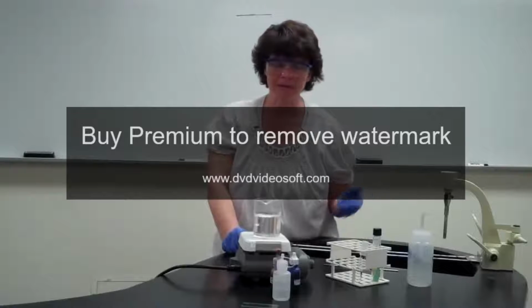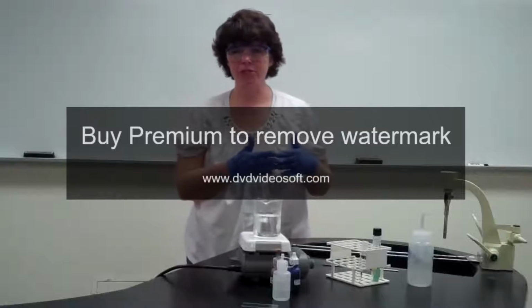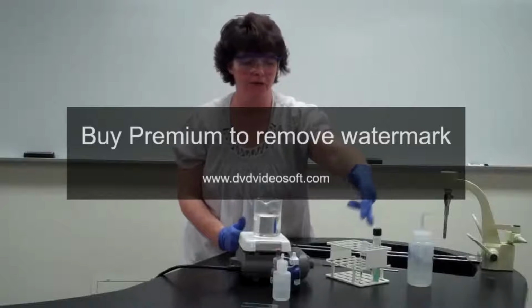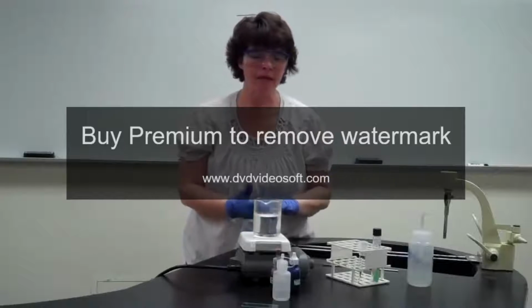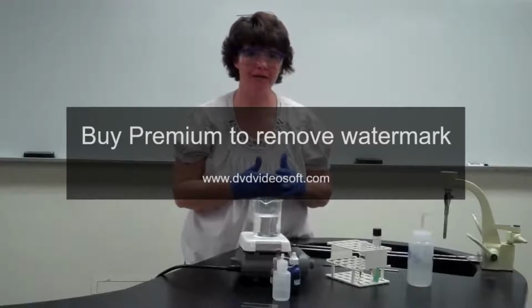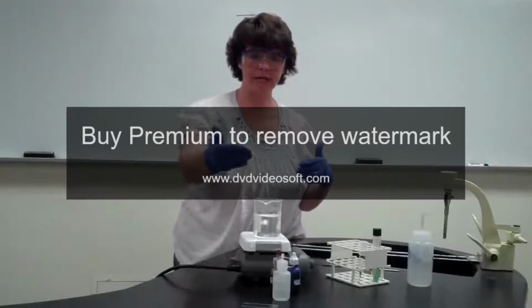Now the changes that I'm going to make: what doesn't change is that you prepare and fix your slide. So whether it's from here or from here, you do the same procedure for the fixing. The changes that I'm making are going to be in the actual procedure of the staining.